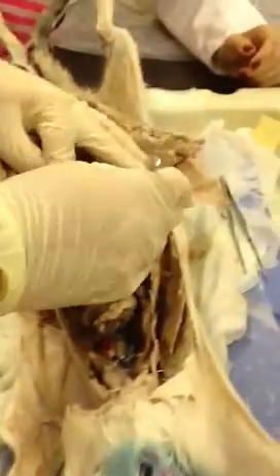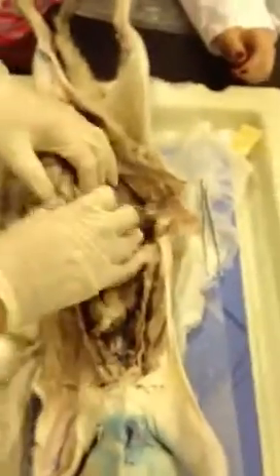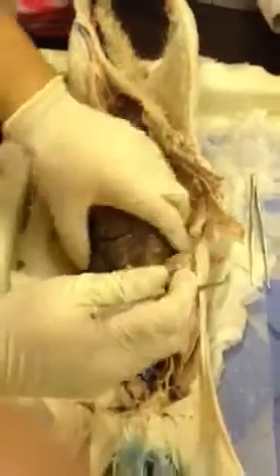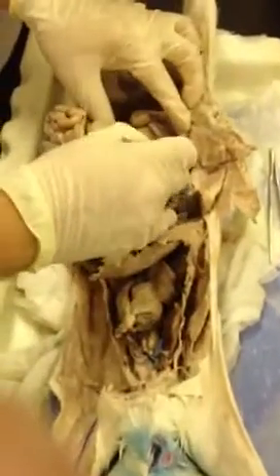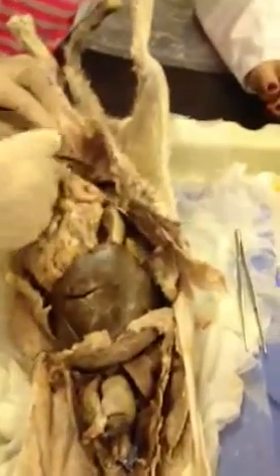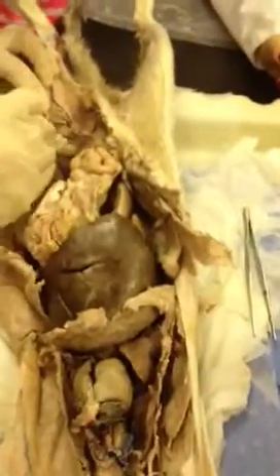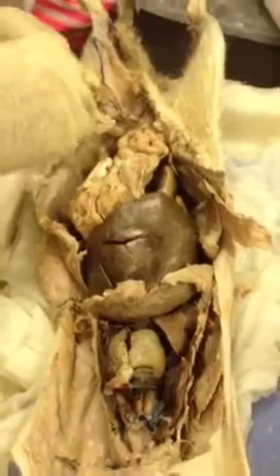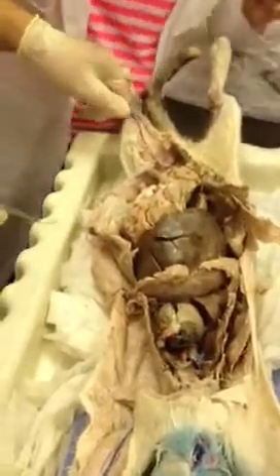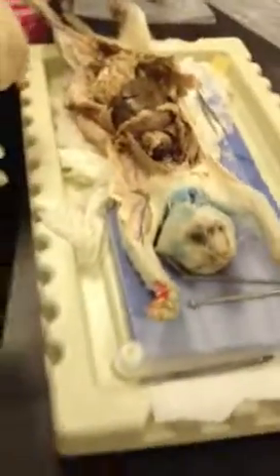And then if we look underneath here, we can see again nice kidney and that renal circulation. The hepatic, we can kind of see buried in here a little bit. And follow this inferior vena cava. We can come down here and pick it up again in the legs, where we have again the femoral coming down here, and then leading towards our tibial, right, which will then lead to the foot. All right, so that'll wrap it up for the cat.